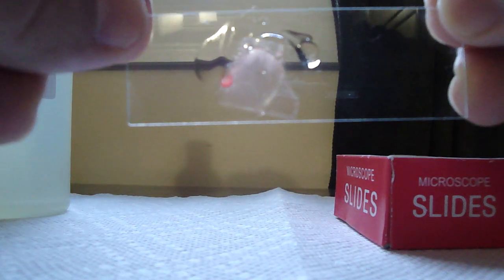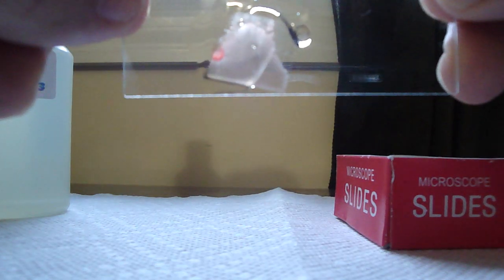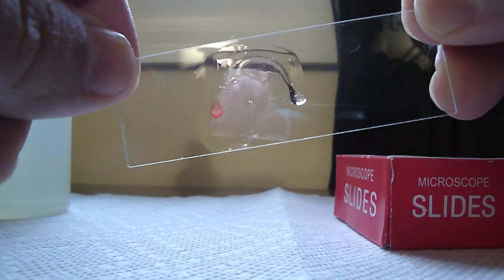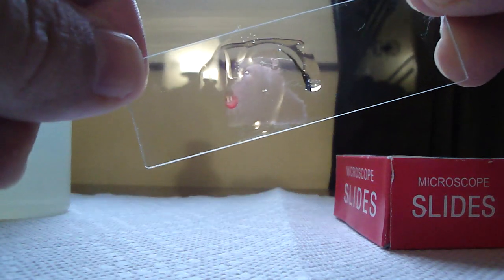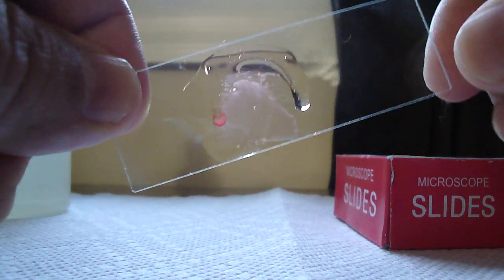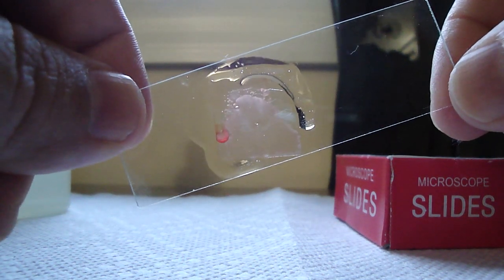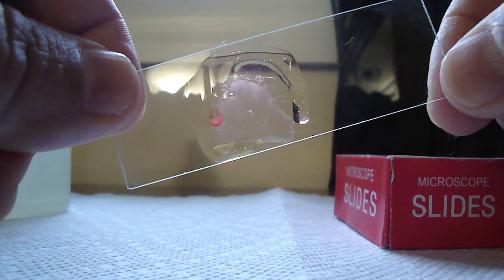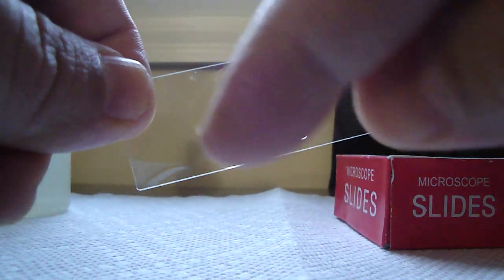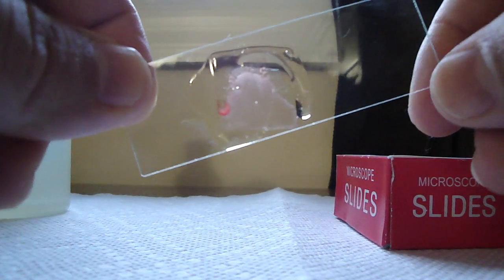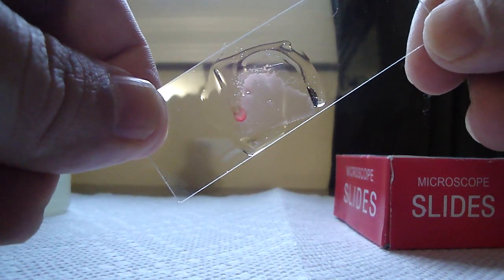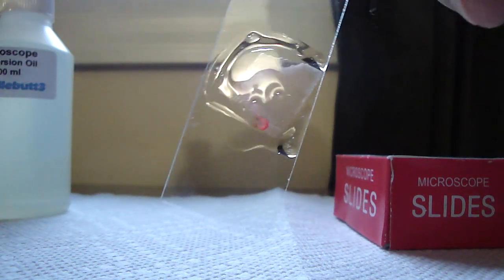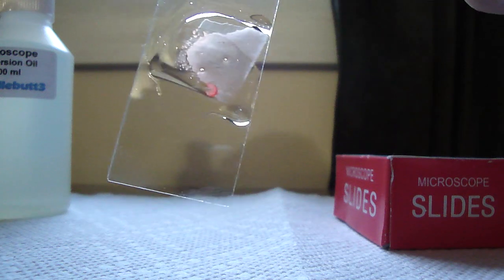And what I'm trying to do here is go down the entire peripheral of the glass slide. I don't know if you can make it out. I usually just go around first, and then I'll hit the centers afterwards. So here, you see how it's dripping? So I do side by side by side until I get the whole slide. This is not the only way to do it. The other way that I've done it is I've taken Vaseline, or I'm sure you can use baby oil as well, and a Q-tip. And just do the peripheral first. So I'll do around the slip cover, and then go back and add the oil immersion in the center. But the whole point of this going down the four sides of the slip cover is to create that vacuum seal.